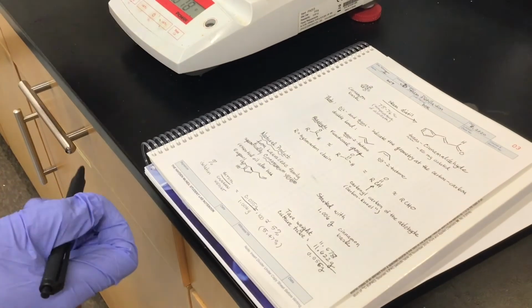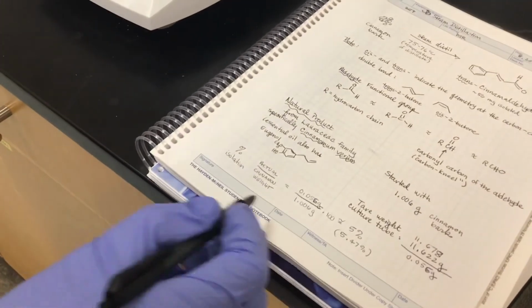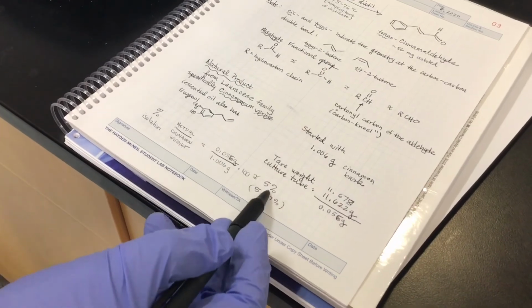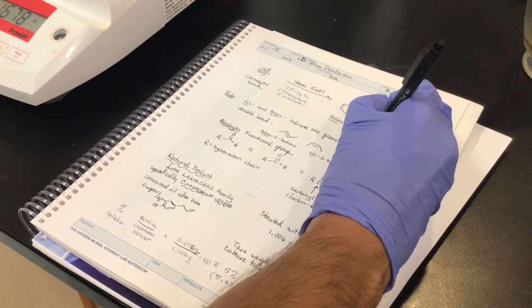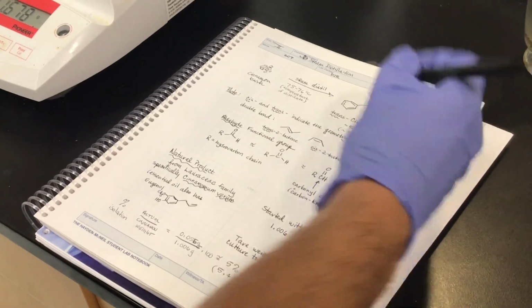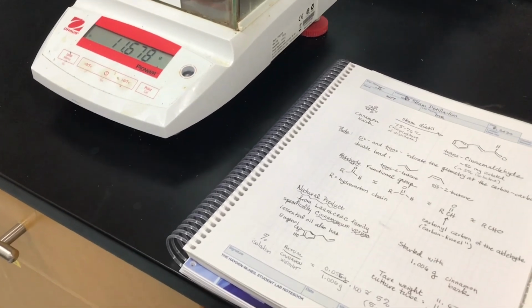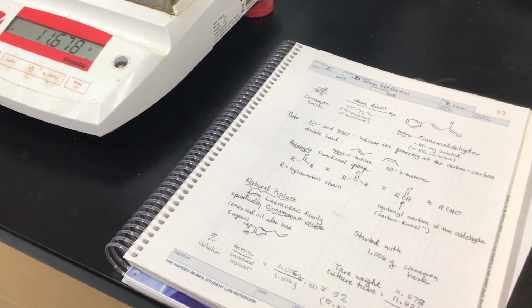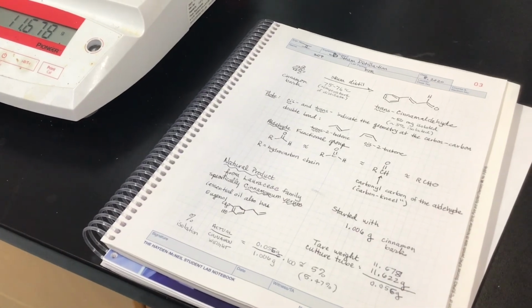And then for the percent isolation, we're going to take that and divide by the original weight of the bark, which was 1.006 grams, multiplied by 100, and it's approximately 5% isolated. So 56 milligrams is about 5% isolated, which is pretty decent and rather typical for each year. So it's not as fun because you can't smell how nice it is, but we just isolated a natural product from cinnamon bark via steam distillation.